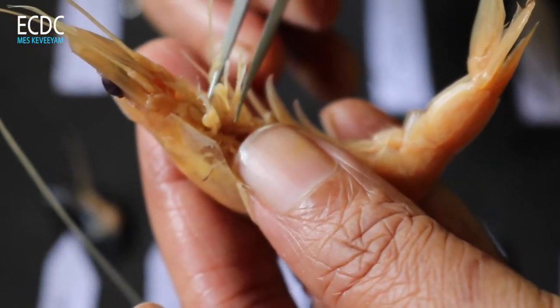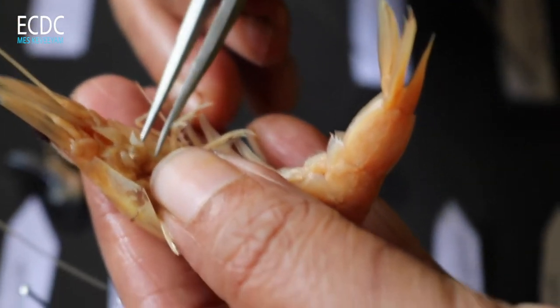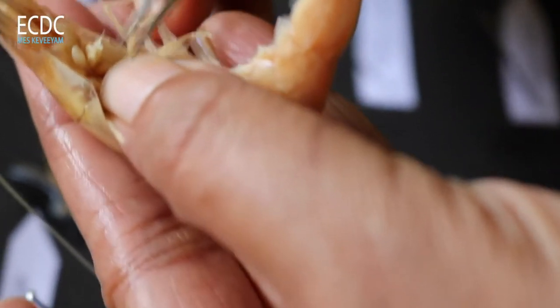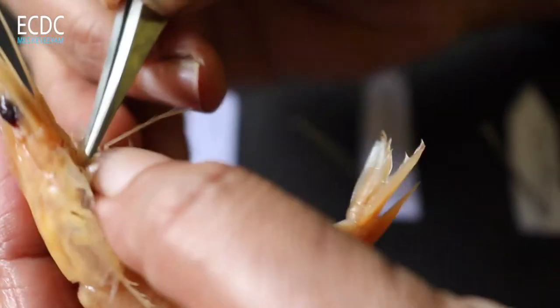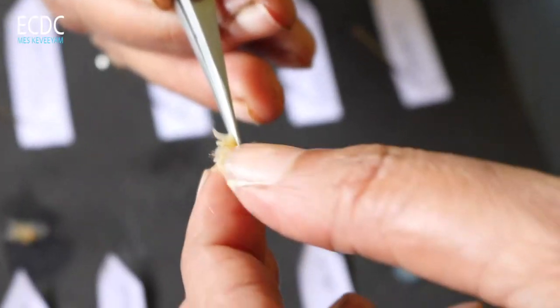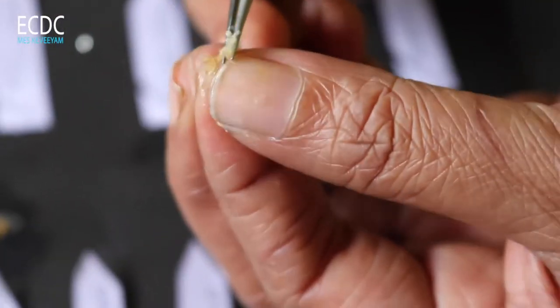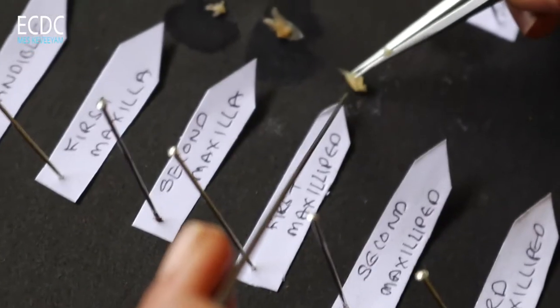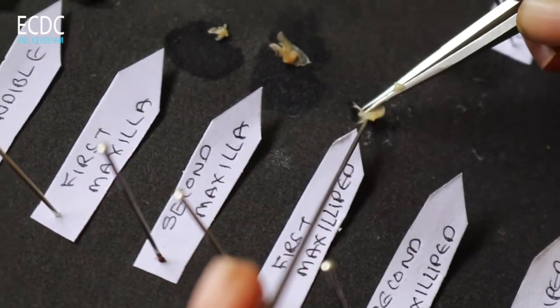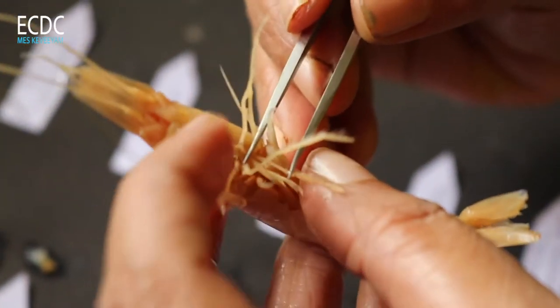This is the first maxillipedes. This is the second maxillipedes and the first maxillipedes. This is the filamentar process. Now we have to examine the second section.